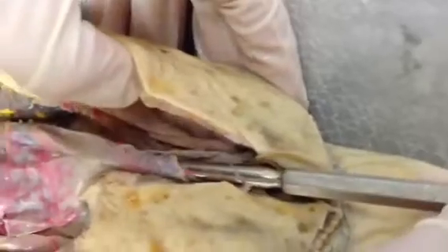You can get the probe through on this side as well. Whenever you can see the probe all the way through, that's an abdominal pore. The cloaca is how all the food and waste comes out — mine's been cut here, but you know you're in the cloaca if you can stick the probe through and see the intestines.